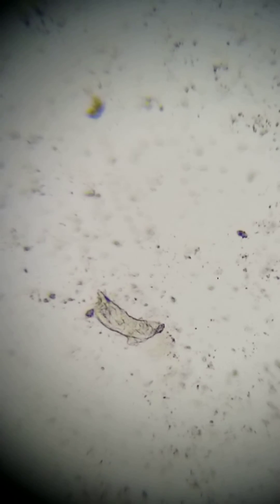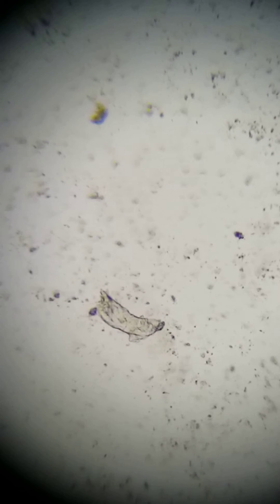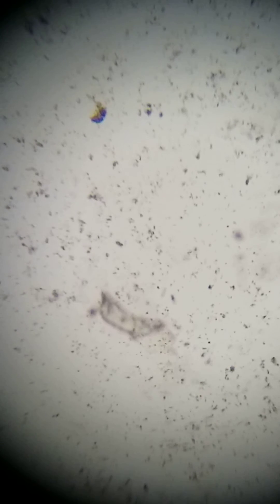That looks like an artifact — it does not look like a cast, so we're going to keep going. The phone sees things differently than my scope does.